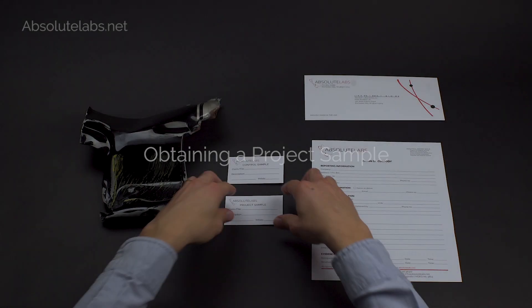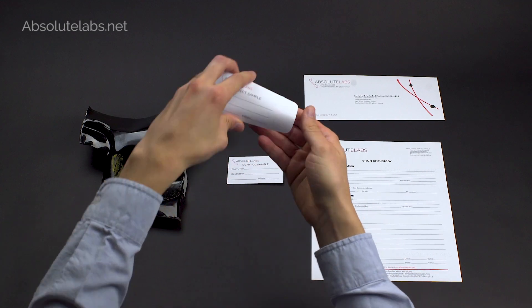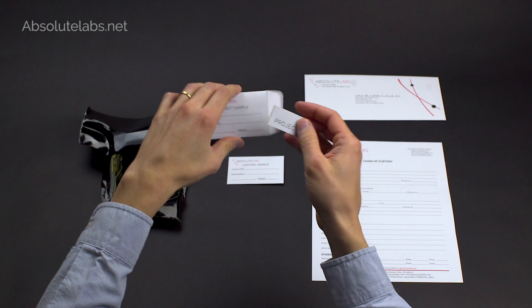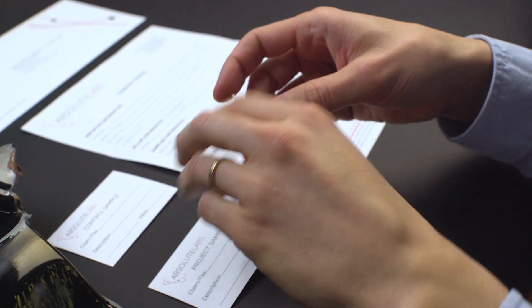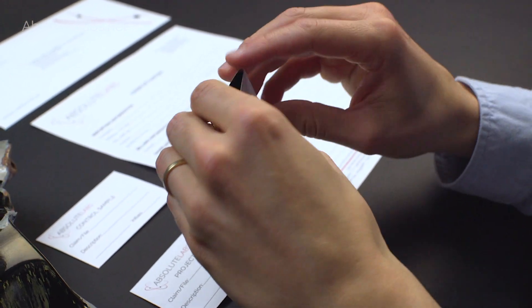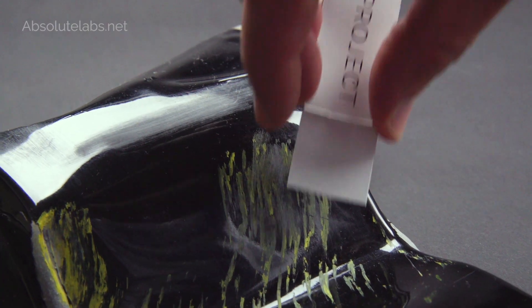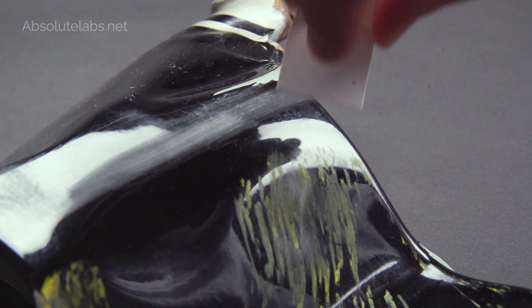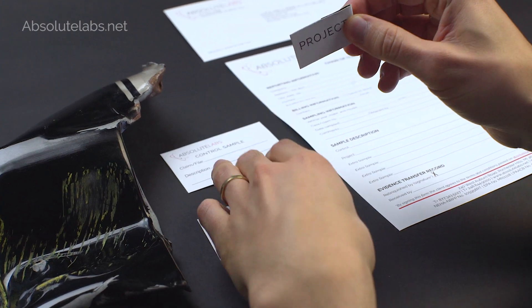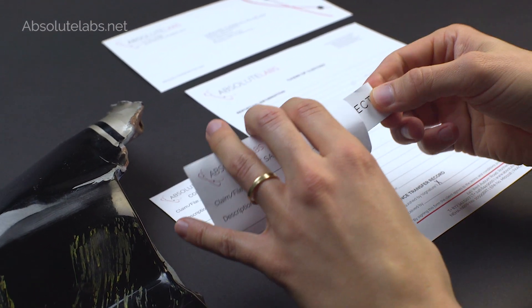Obtaining a project sample: Start by opening the project envelope and removing the abrasive sampler. Do not remove labels. Hold the sampler by the sides. Avoid touching the abrasive sample area, and then lightly wipe across the surface of the suspect residue. Fold the sampler back onto itself and return it to the project envelope.